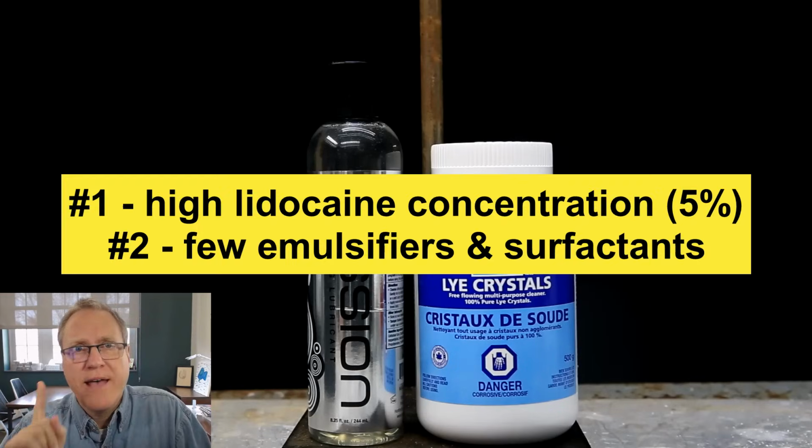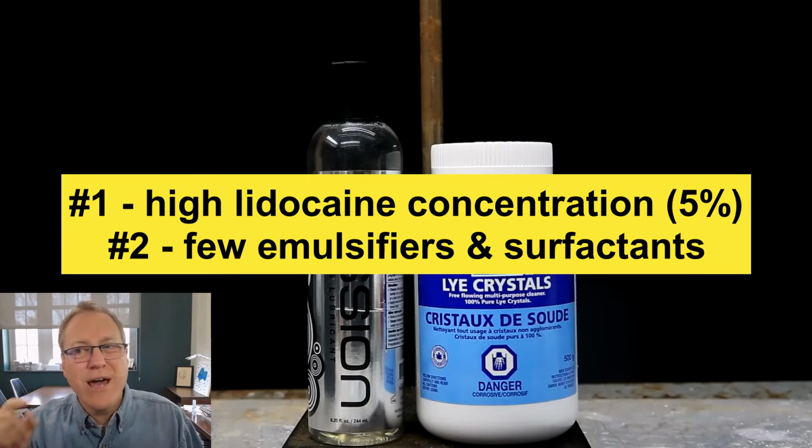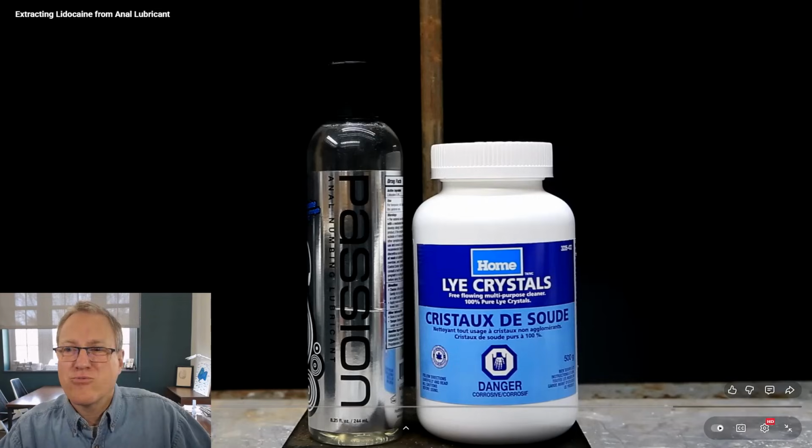So it has a high concentration of the active ingredient, in this case lidocaine, and 2, it doesn't have a lot of other substances. It doesn't have a lot of emulsifiers or other things that are added as inactive ingredients that make the extraction difficult. So he's chosen this carefully, and he'll give references to why he chose this again later in the video.